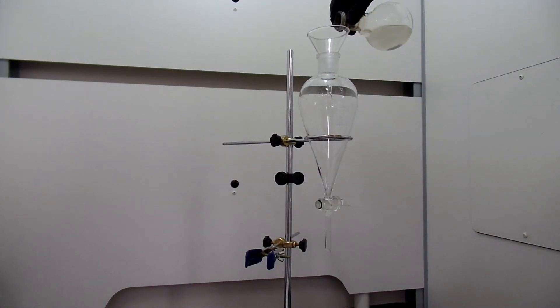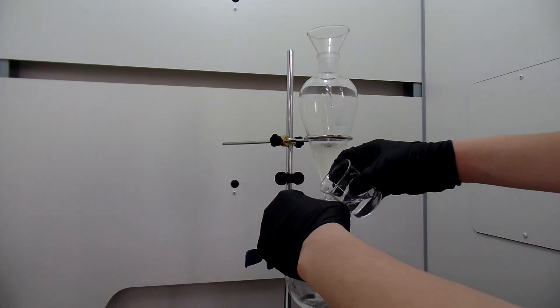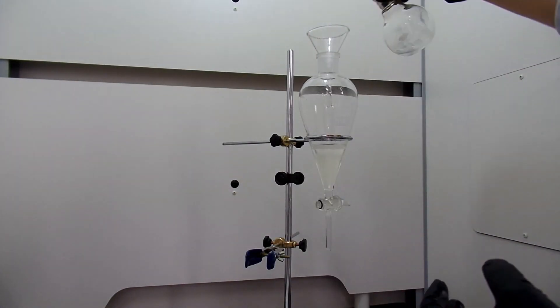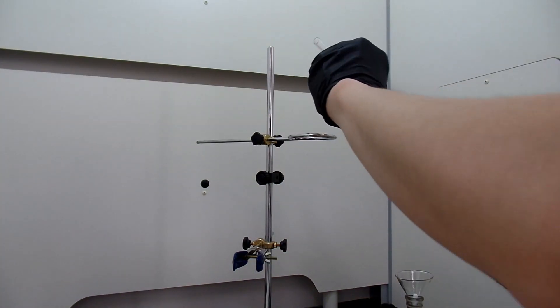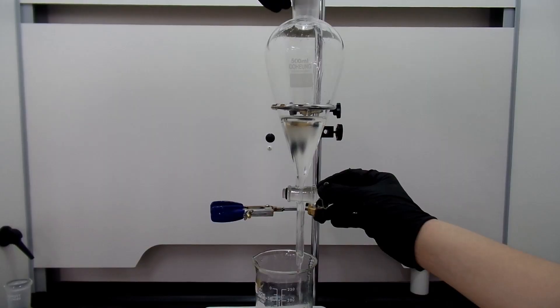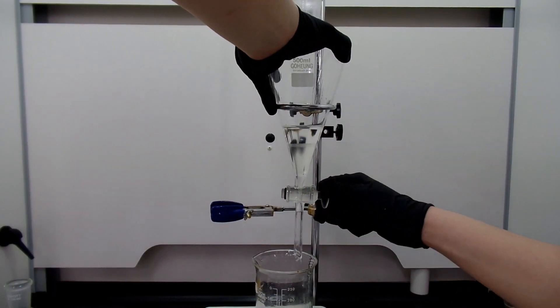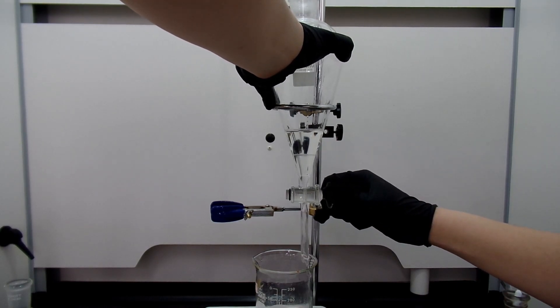After about 10–20 minutes, cold water is added. The mixture is poured into a separatory funnel. Then the round bottom flask is washed with about 20 ml of water. Shake the separatory funnel vigorously with venting. The aqueous layer, which consists of water, acetic acid, and sulfuric acid, is denser than our target N-propyl acetate. So after letting the layers settle, the bottom aqueous layer is discarded.